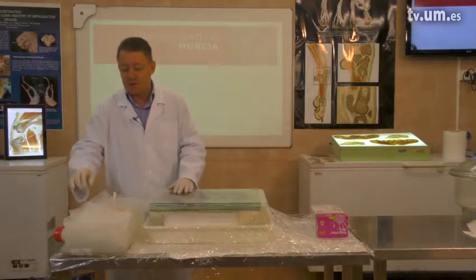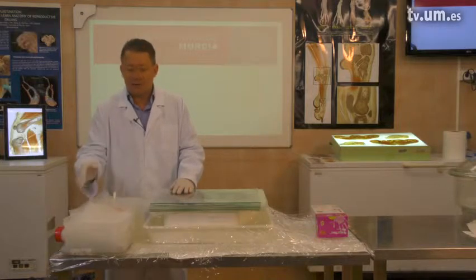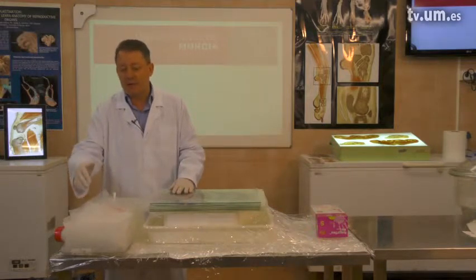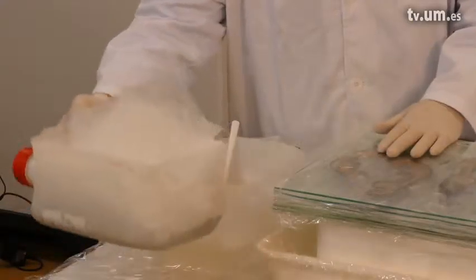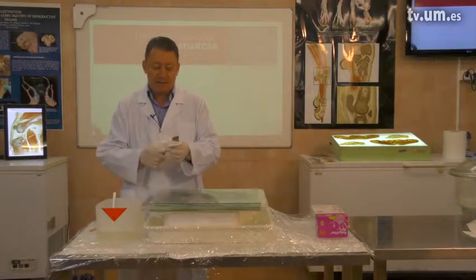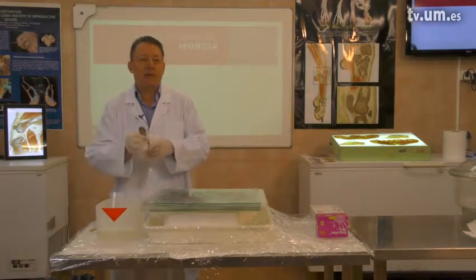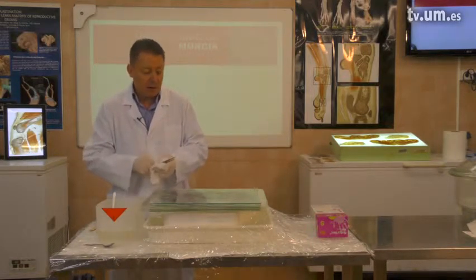Everything we have used — every grid, every gauze, every additional structure used in the impregnation — will have to be thrown away. You can't reuse the grids; you can't wash them or keep them, because epoxy is a glue and it will get hard after one day. Everything you have used, just throw it away. The only things you have to clean and keep are the instruments. Instruments have to be cleaned with paper, and you will reuse them for the next impregnation or the next sandwich building.